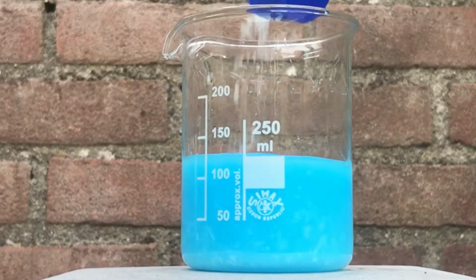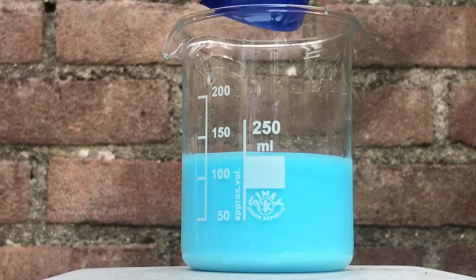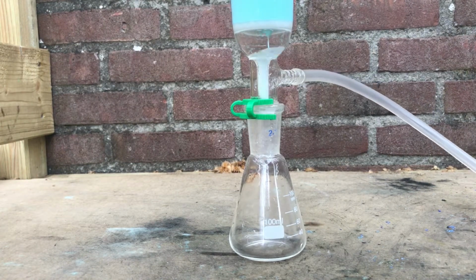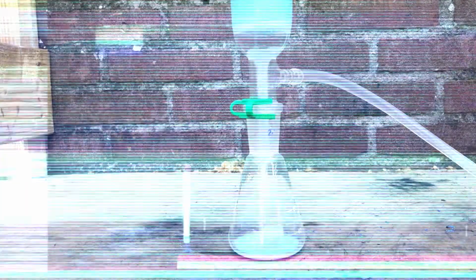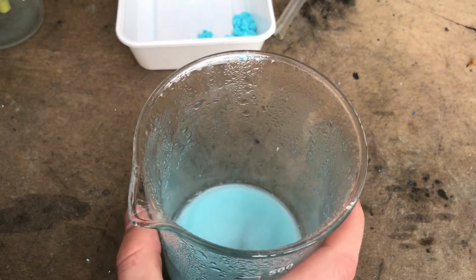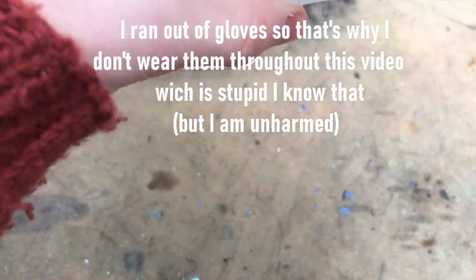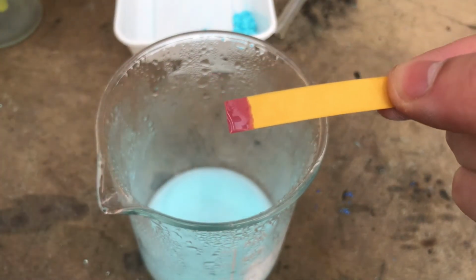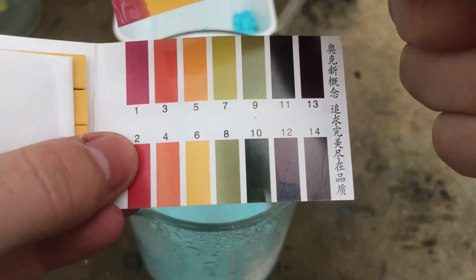To isolate the sulfuric acid, we need to filter off the copper oxalate. This turned out to be easier said than done, because it took me like an hour to filter that stuff. So after you're done filtering your suspension, you should be left with just a solution of some sulfuric acid. The only thing left to do is boil down to increase the concentration. In my case, there's still some copper oxalate in suspension, but I will filter it a second time.